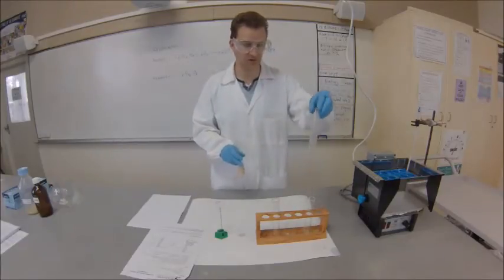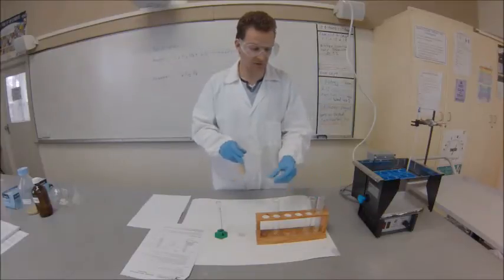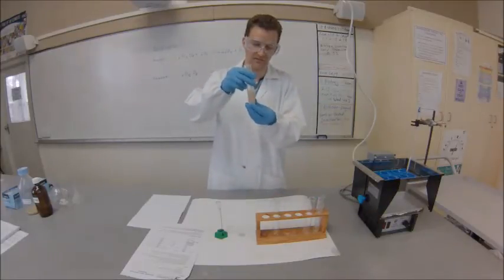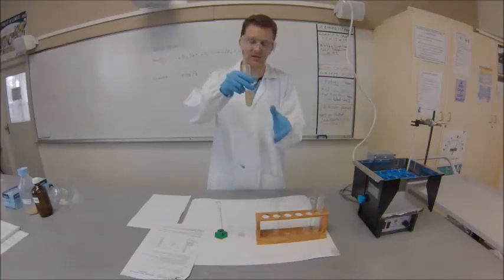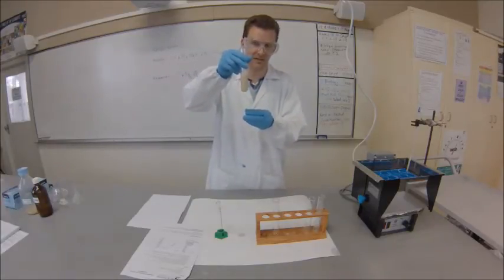Now we've taken the tubes out - they were incubating, so we're at temperature. We've poured the yeast into the glucose solution and mixed them together.